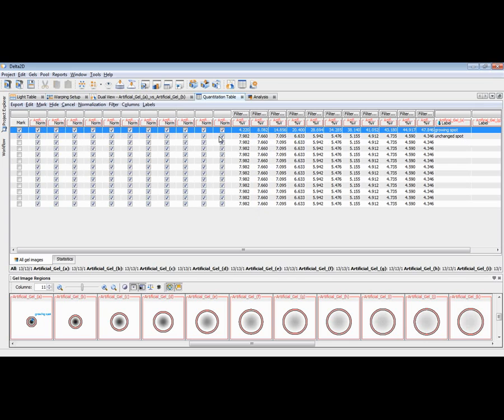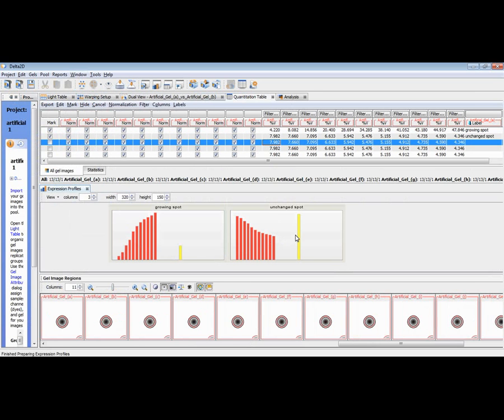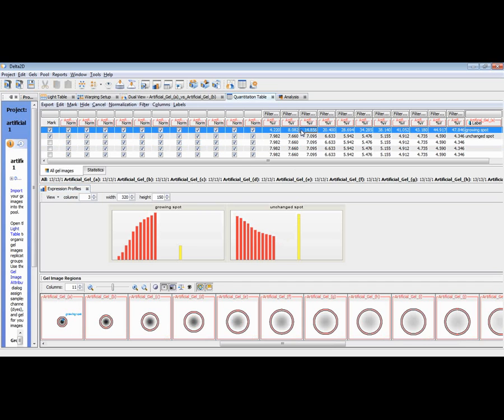Let me do this. Normalization, include this spot in the normalization set. Now you can see that all these checkboxes are checked again, and then you can see that all the other spot quantities are going down since they are normalized against an increasing sum of spots. We can see this even better in the expression profile window. Here we have the growing spot and one of the other spots. It's unchanged, but in our measurement where we do not exclude this growing spot from the normalization basis, it would look as if this spot had a decreasing spot volume. That's why we want to exclude this large growing spot from our normalization basis, and you should do this typically if there are a few spots that are very large and are changing.